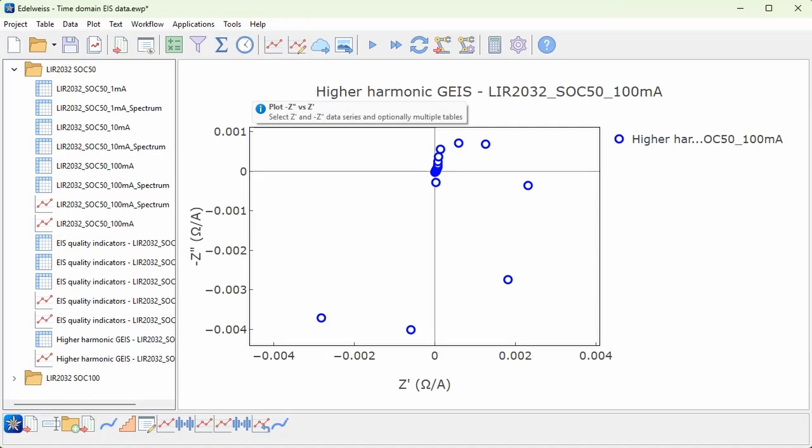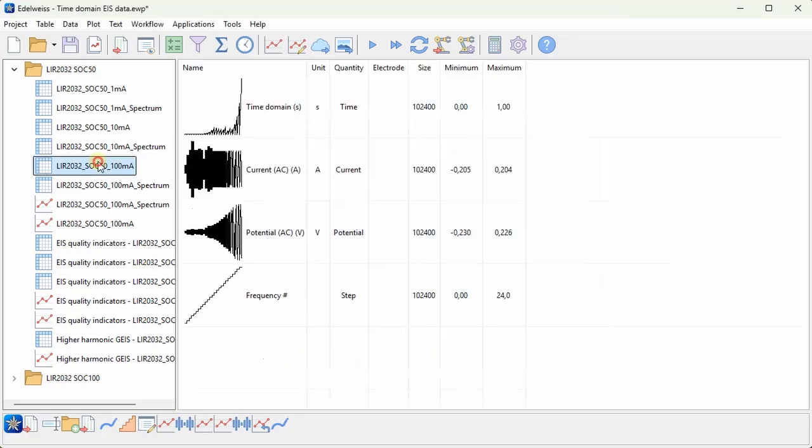And again, it's outside of the scope of this video to go through how to analyze higher harmonic impedance spectra, but quite typical here for these kind of lithium-ion batteries is that you get most of the data points close to zero, and then you get these kind of spirals. And the size and shape of this spiral can tell you something about the symmetry of the oxidation and reduction reactions of each electrode.